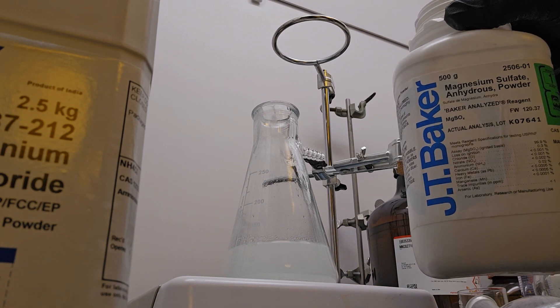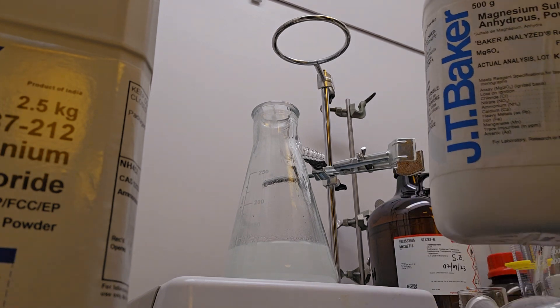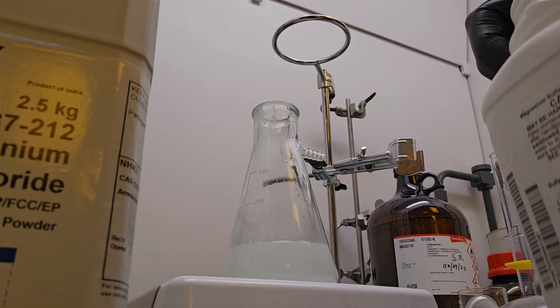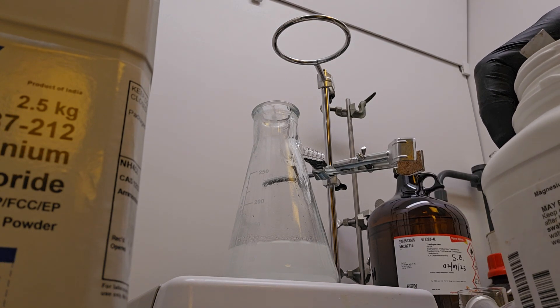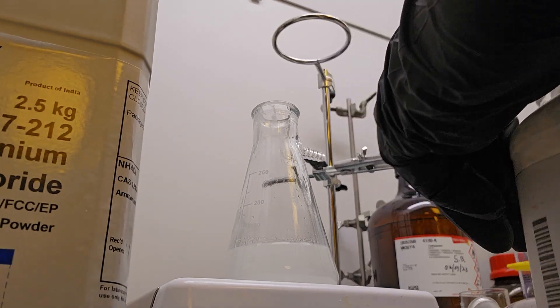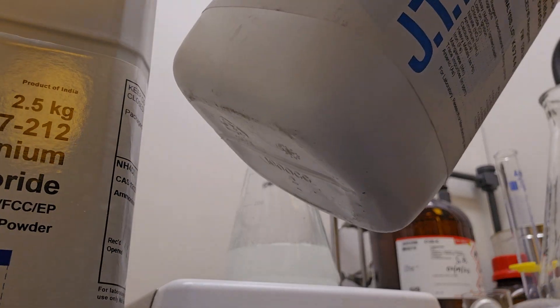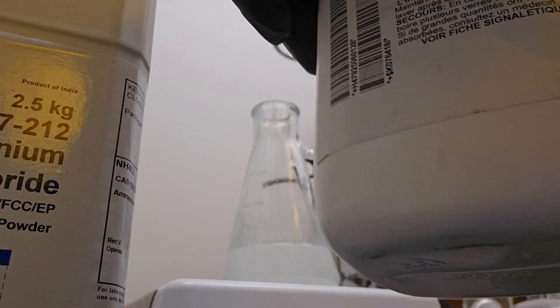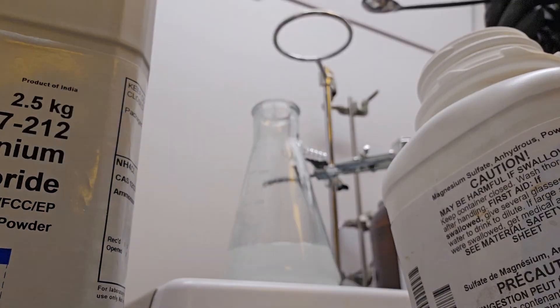And this should grab all the remaining water molecules in this mixture and adhere to the water and not allow any water to get out of the solution.